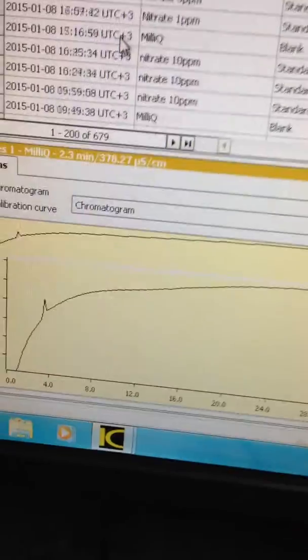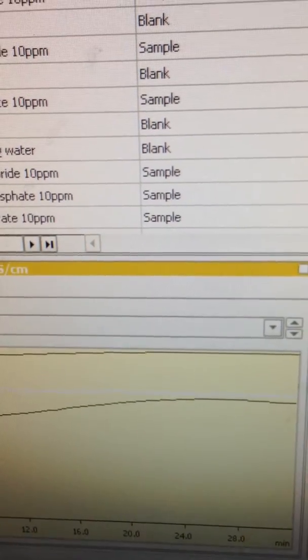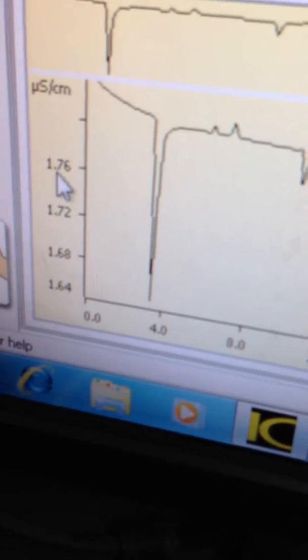So if we go up here now, you can see now my MilliQ water. If I click on that, here the conductance is very low now, it's 1.7.